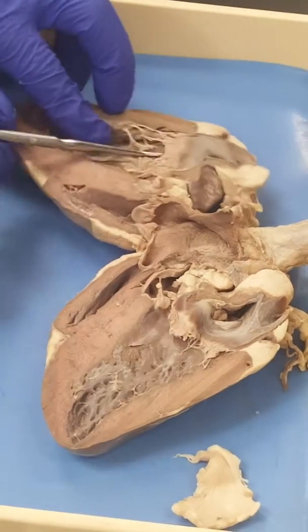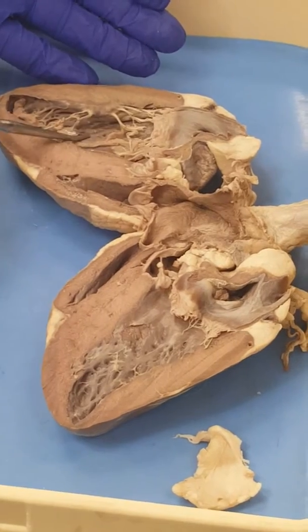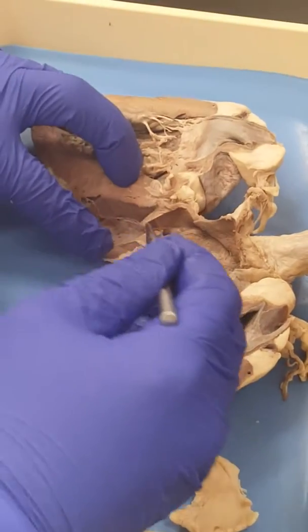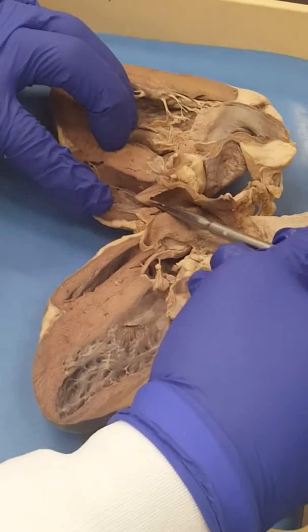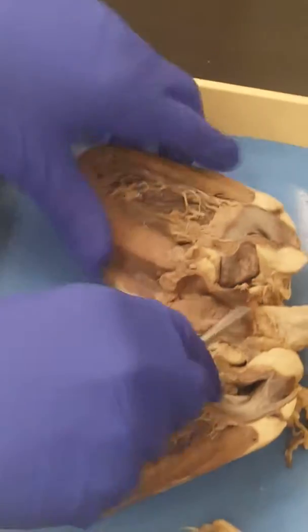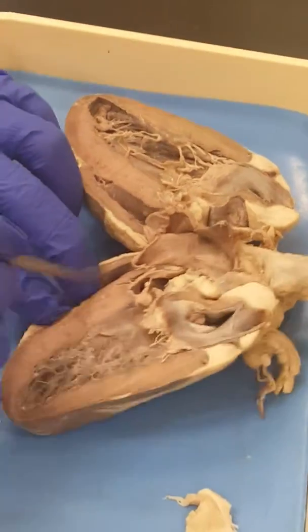You see how it's facing up? You see how this one is facing down like that? So that blood, when it's pushed in the ventricle, it prevents it from going back into the atria. And this is facing up, you see, look at it. So that means when this ventricle relaxes and blood tries to come back, then it prevents blood. So this will be the pulmonary semilunar valve, because this is the pulmonary trunk, right? Okay, good.